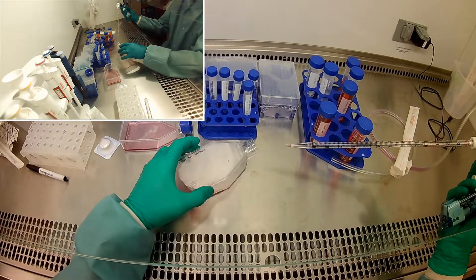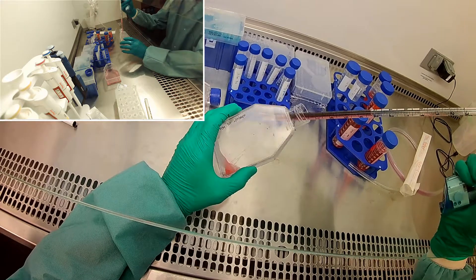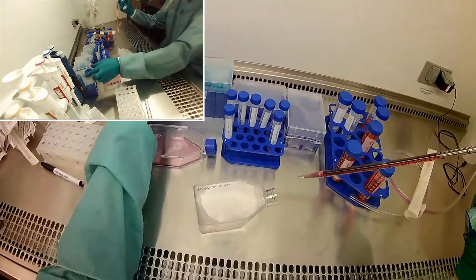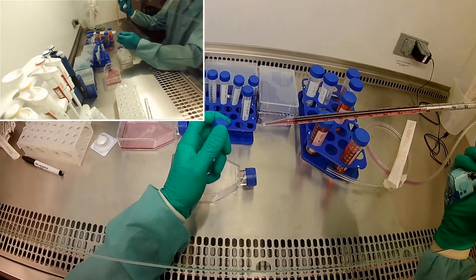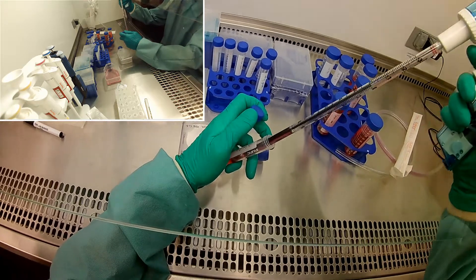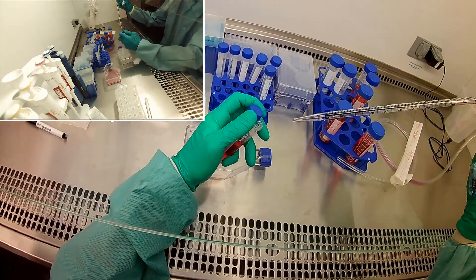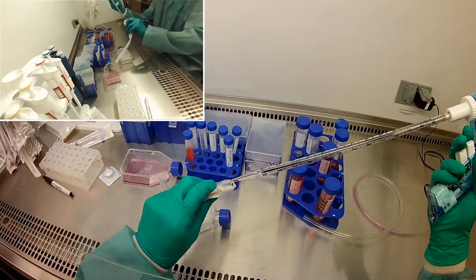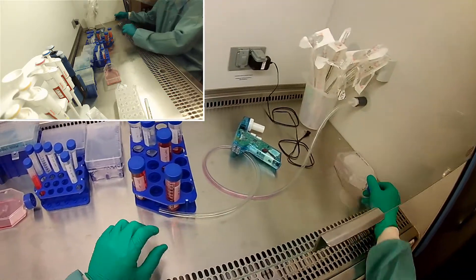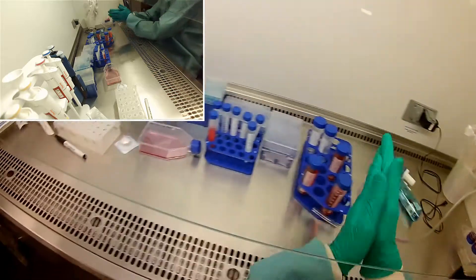That flask I'm not going to worry too much about anymore. We have so many cells — you can tell you get a lot of cells when your media is cloudy in the resuspension. So just making sure I wash as many as I can off. Mix them up well. I have my 15 ml tube here that says 'cells from flask.' I'm going to go ahead and mix just to make sure. I've also got to get these things out because both of those I'm going to trash, so I'll put them over here so I don't forget.